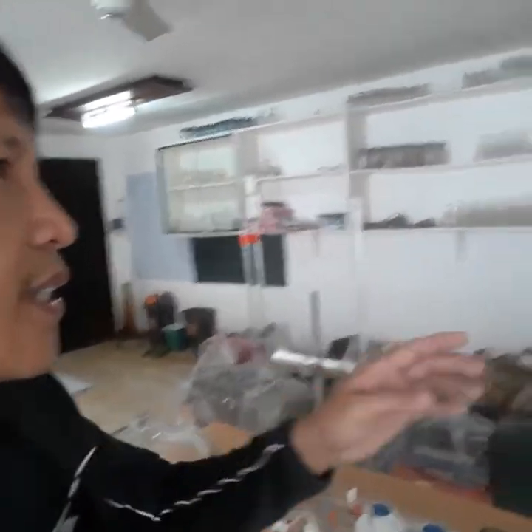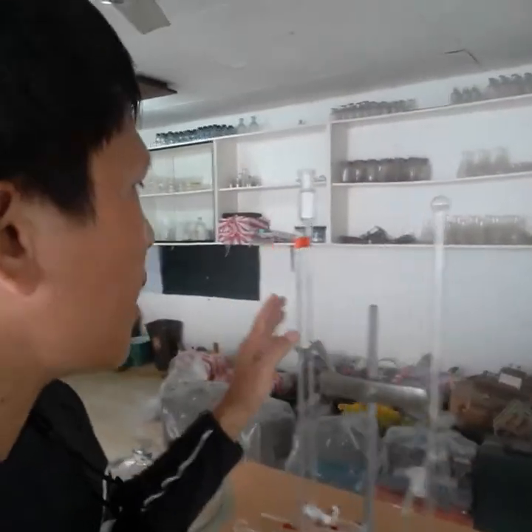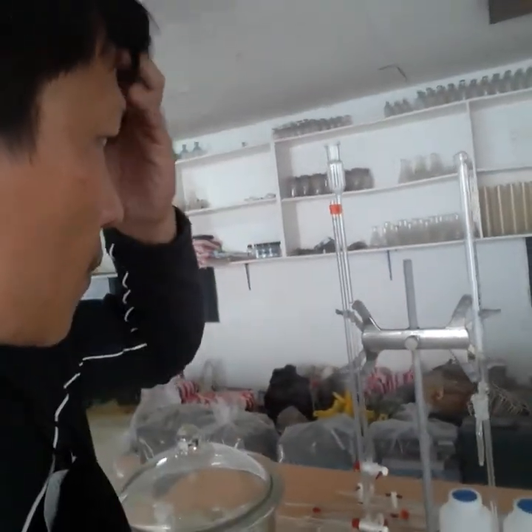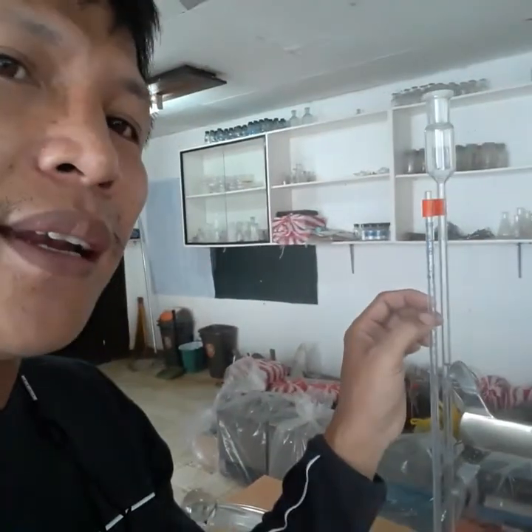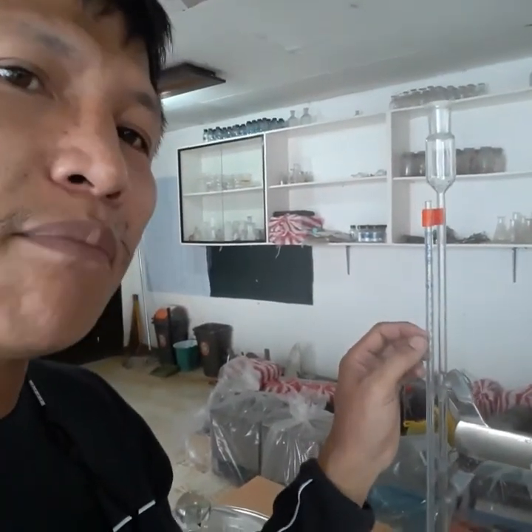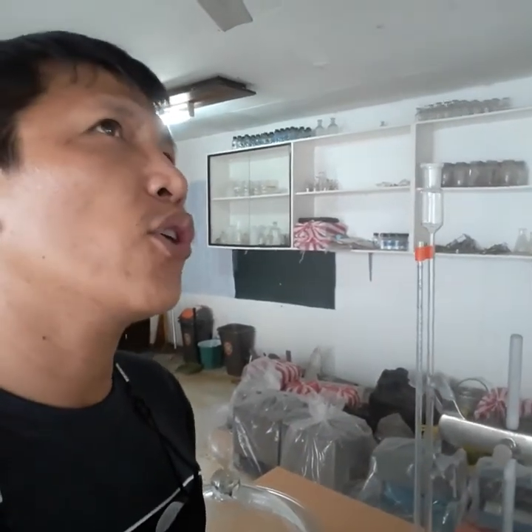The next item would be, again, burets. So these are different kinds of burets. As you can see, we have different kinds of burets. This one is a micro buret because of the markings, the ml that this buret can measure. Again, the definition of your buret is accurate measurement of your volume. As you can see, your graduated, I mean, those that can measure accurate volume.